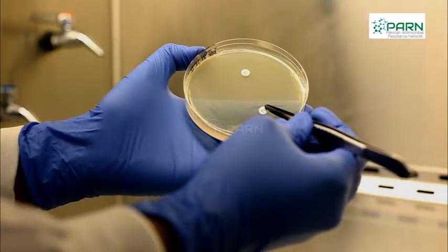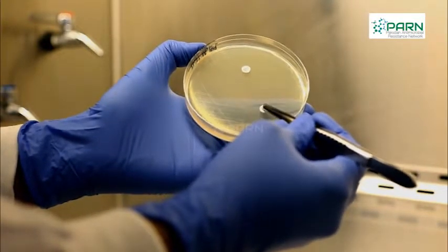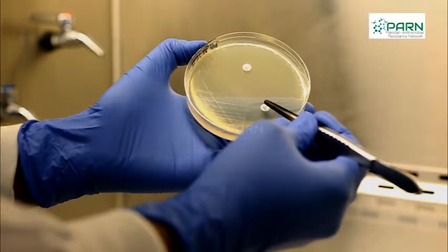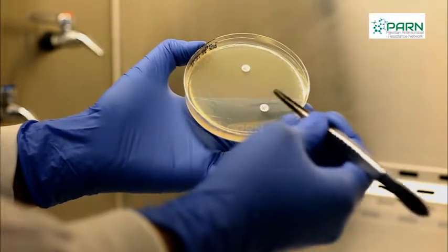Number of discs on a plate shouldn't be more than 6 discs on a standard 100 mm plate to avoid overlapping of zone sizes.